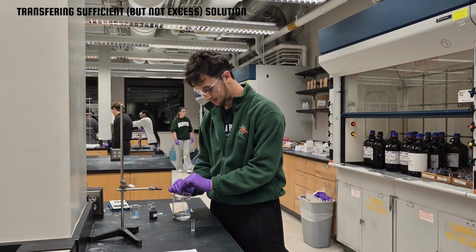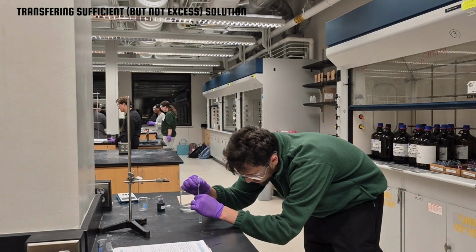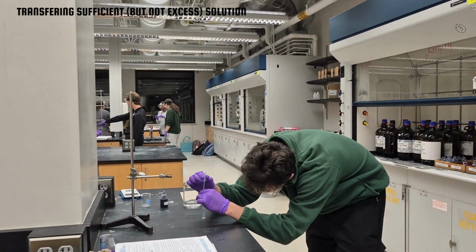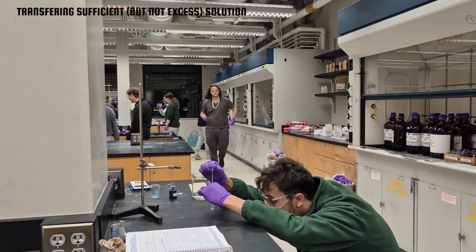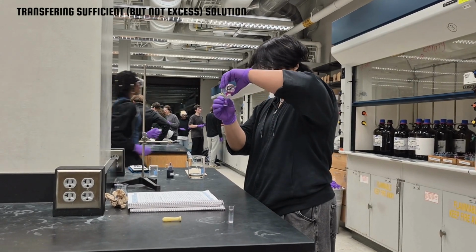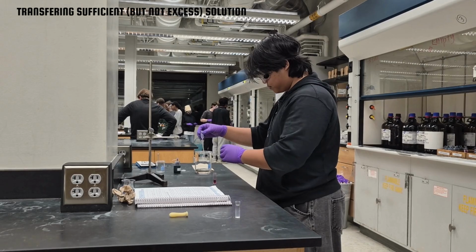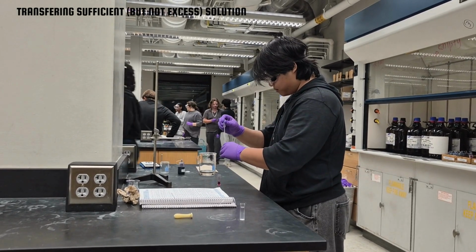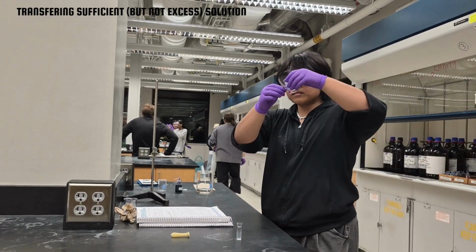Now for the experiment. For our experiment, we had 3 different solutions, 1 blank solution and 2 experimental solutions. We transferred these solutions to cuvettes to be used in the spectrophotometer. When transferring your solution to the cuvette, don't pour too much, nor too little, make it just right, like Goldilocks, but with acid. If you have too little experimental solution or some is still left in the beaker, wash or fill the remaining with the blank solution. For our case, water.